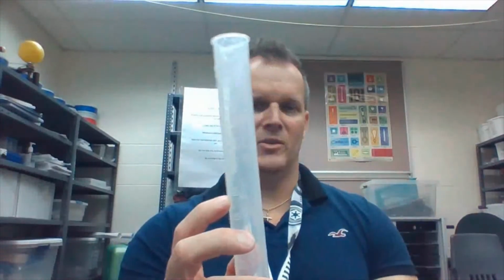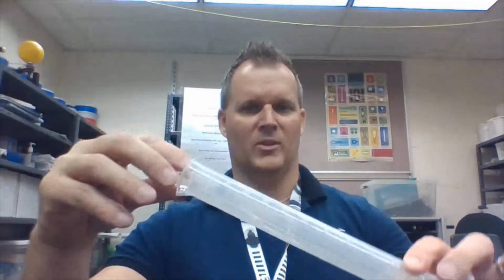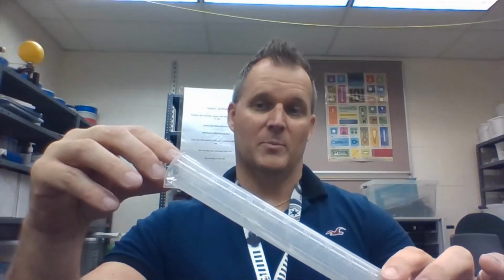So first, they'll measure the mass of these two, and then the next part, they will actually find the volume. So again, they will measure water, 50 milliliters, accurately. Then they'll take the first ball, that can be the nylon, it doesn't matter. I always tell them to tilt to the side so they don't get spillage, and let that go into the graduated cylinder.